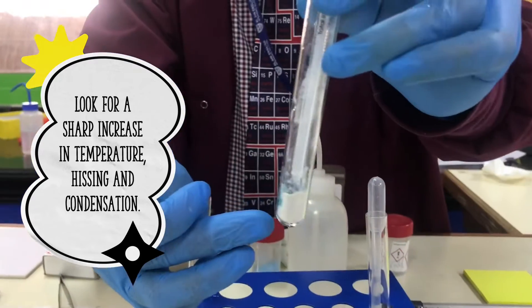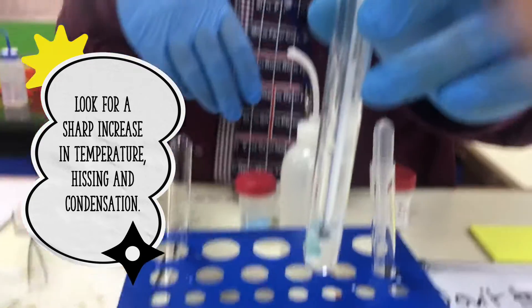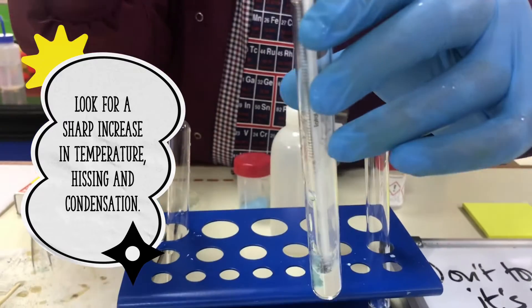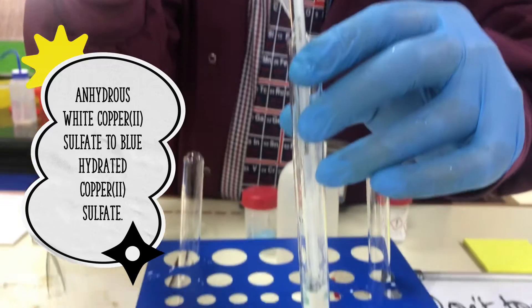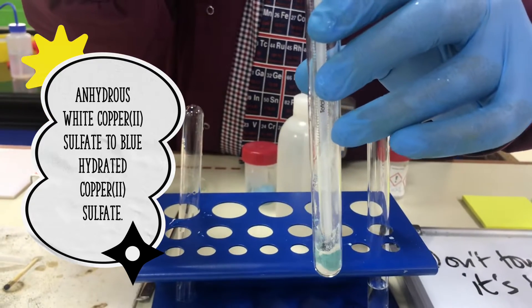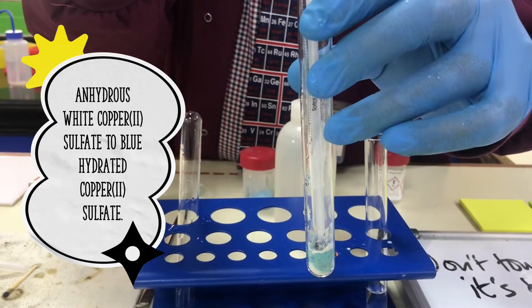And what you'll also notice is that this has now turned blue because the anhydrous copper sulfate is now turning into hydrated copper sulfate.